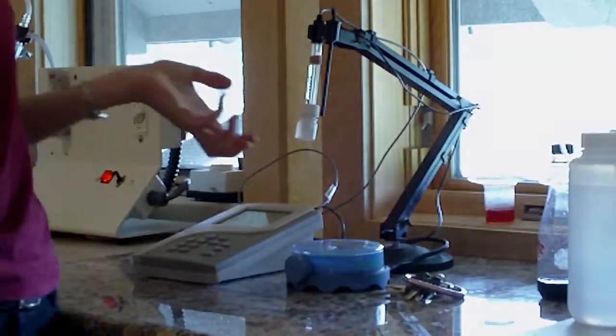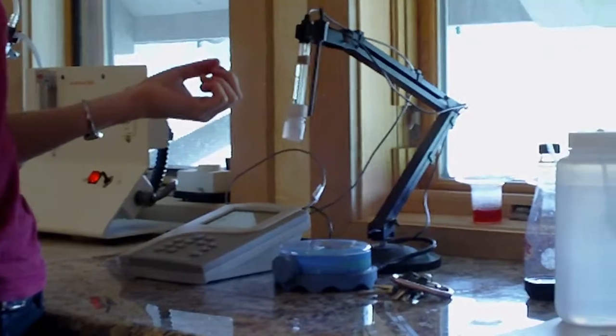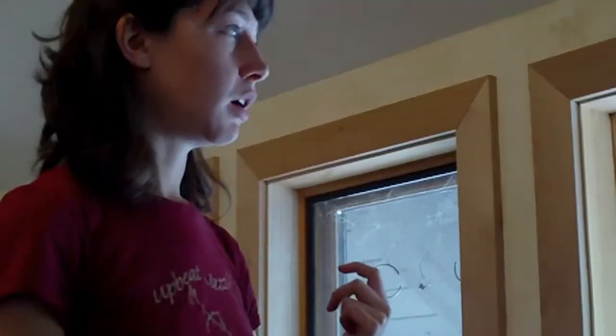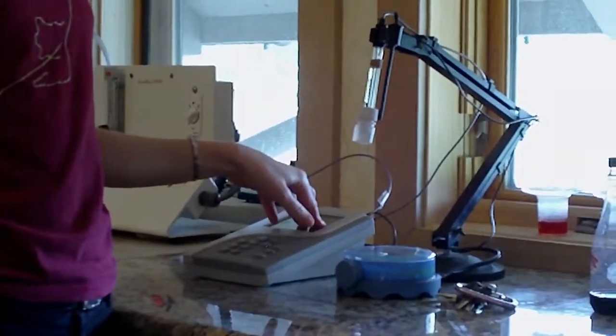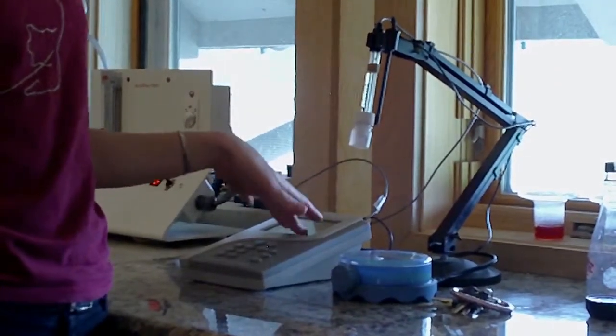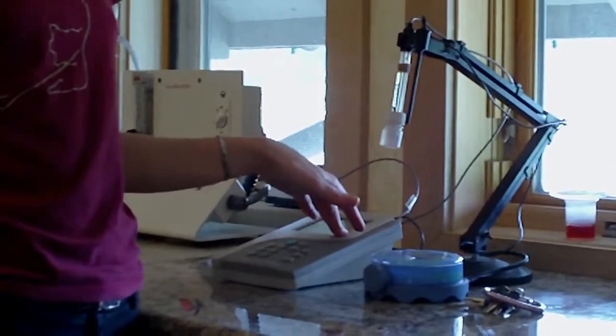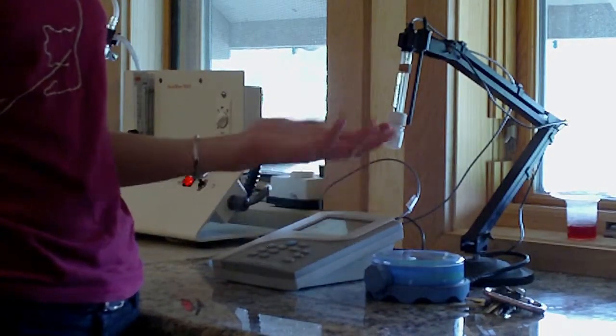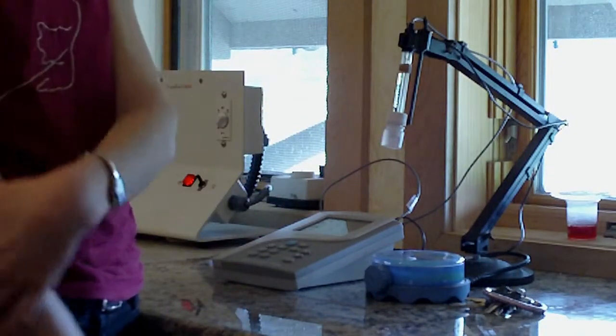And you run multiple tests, obviously the pH of the wine, but also we use it to find the total acidity in the wine, to test ammonia levels, and that's about it what I do with this. And this is the probe that goes into the wine, and then this machine will tell me what the pH is. Usually we'll have a pH between like 3.3 and 4.1 for our aging wines. Lately grapes have just been coming in with a higher pH, which means they're more basic. But you want a wine that is more acidic than basic because that gives it a brighter flavor, it lifts the wine's flavor.